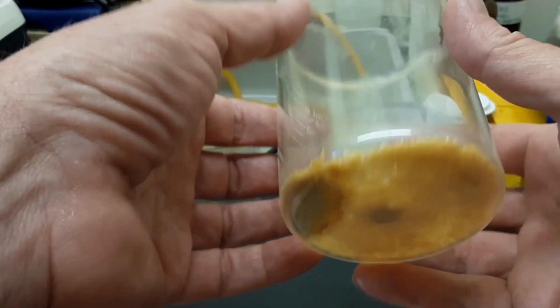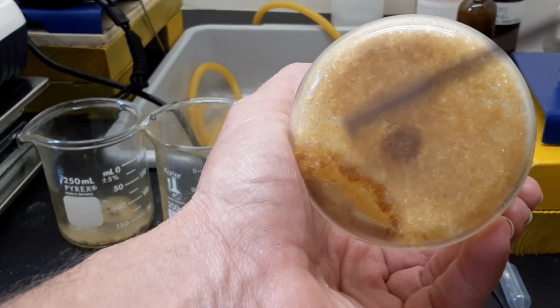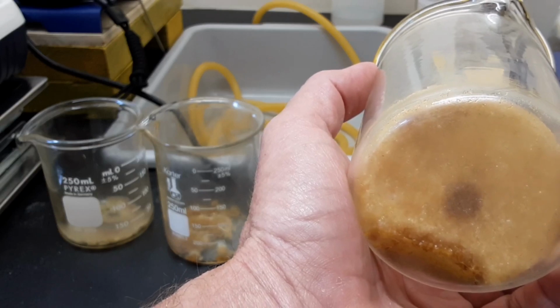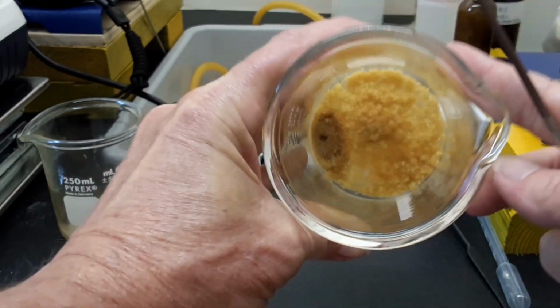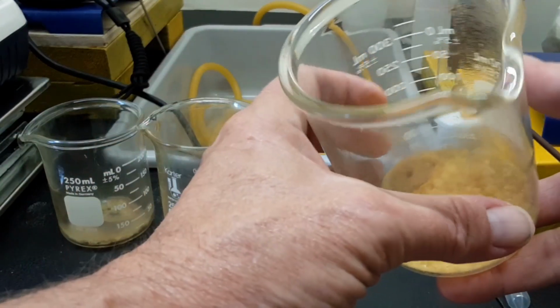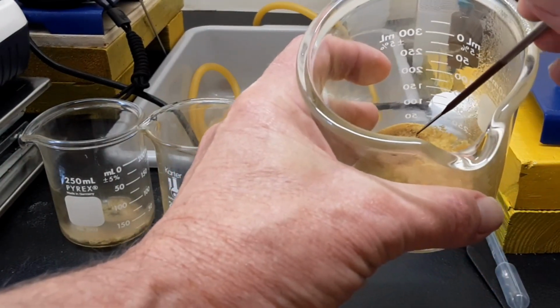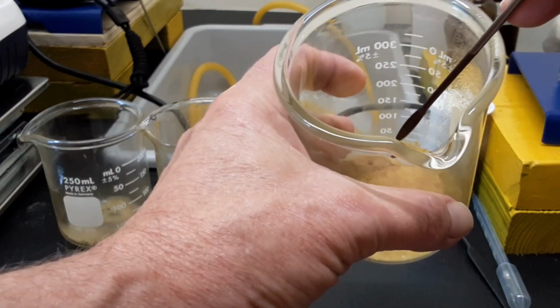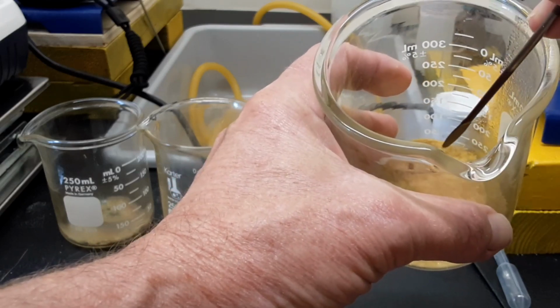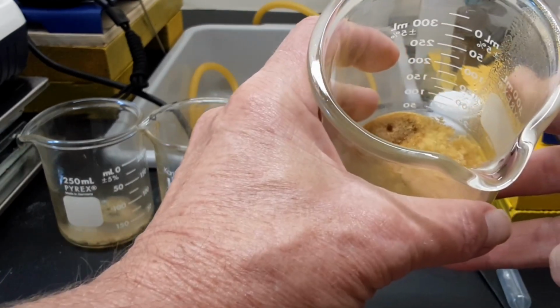The beaker's very dirty, so it's kind of hard to see, but it does have some nice crystal structure to it over in here. Yeah, it's kind of what I thought. It's going to fall out of there again, but yeah, I'm not sure what to make of that. Why it turned more brown on the bottom around the edge just setting outside and got the volcano in it, I don't know. Prior to that, when I took it outside and I looked in it, it looked like a big pile of mold spores. That was really the only way I could describe it. And of course it isn't mold spores, and it still has that kind of spore look to it around the outside. Don't really know why that is the way it is.